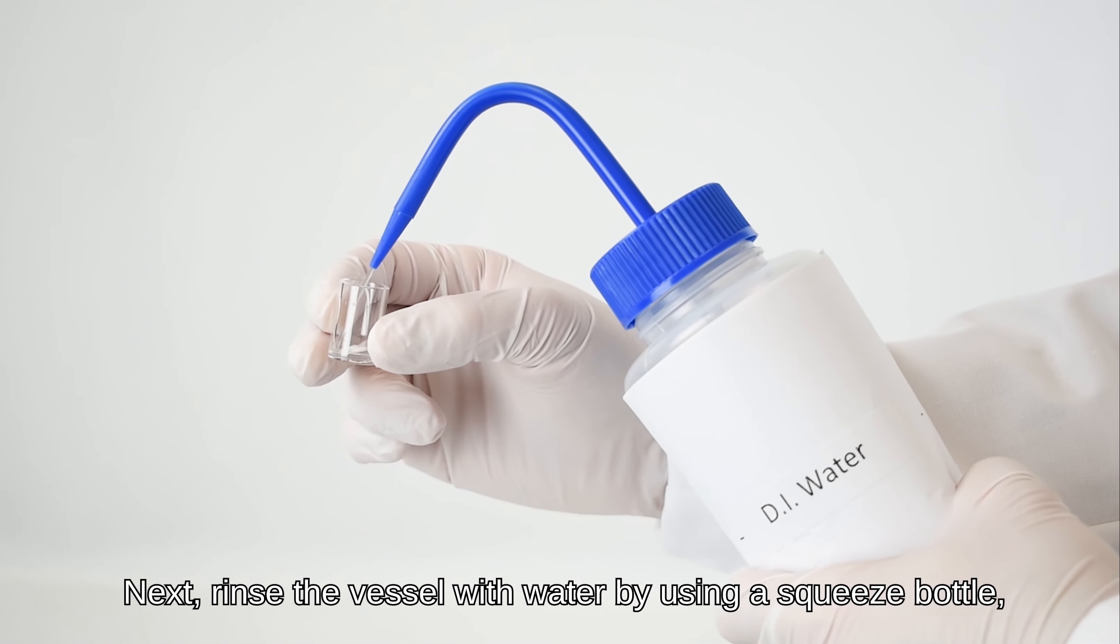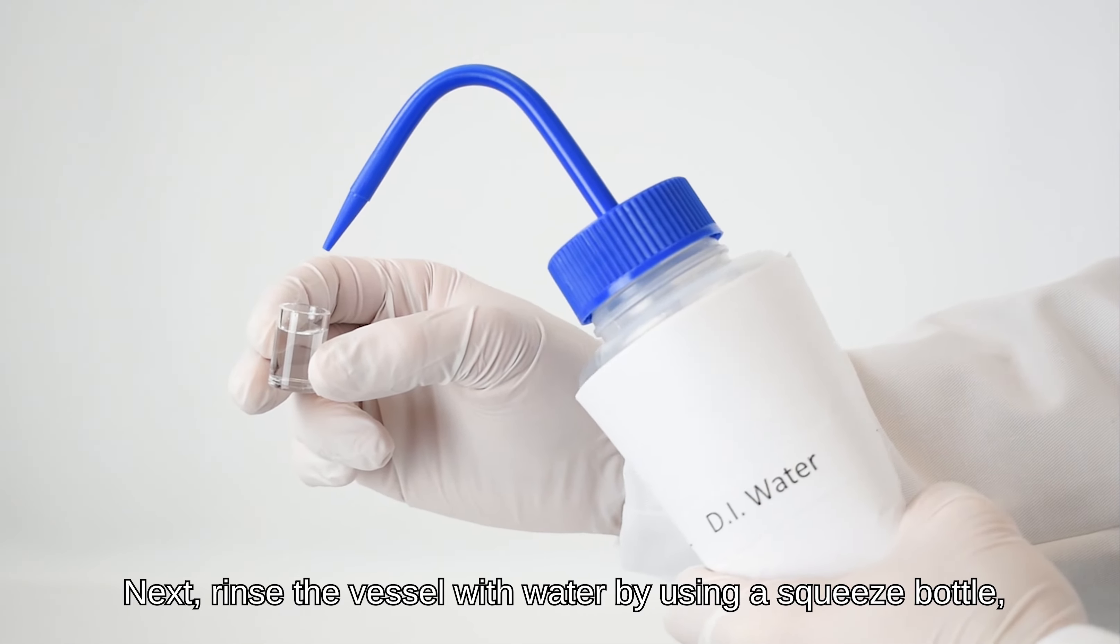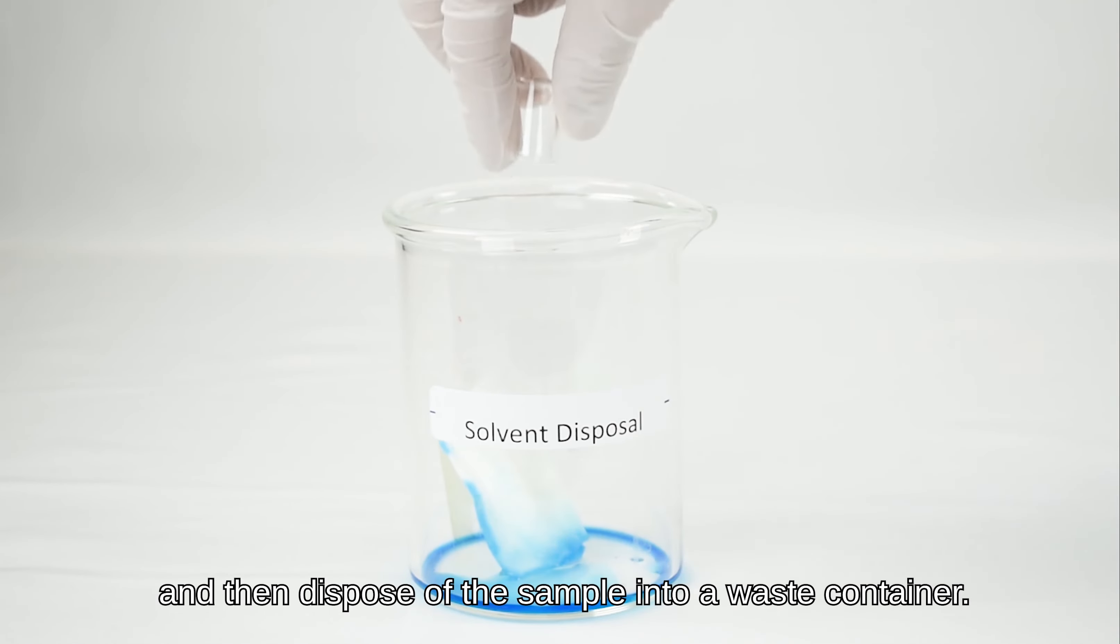Next, rinse the vessel with water by using a squeeze bottle and then dispose of the sample into a waste container.